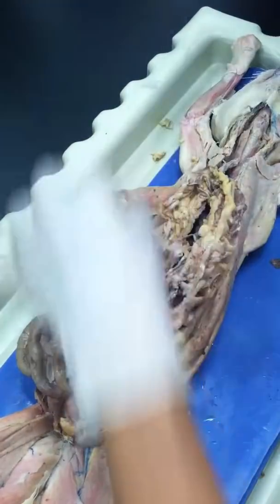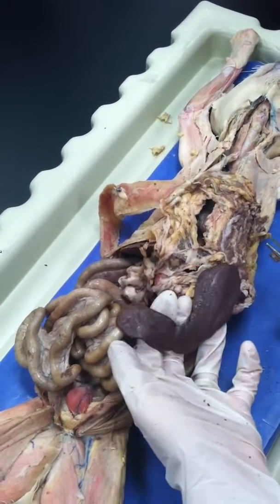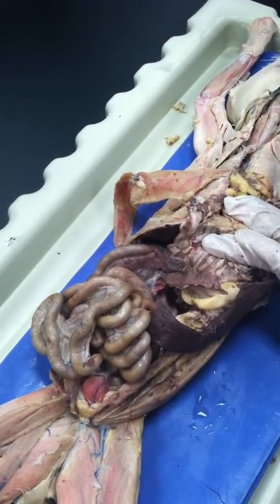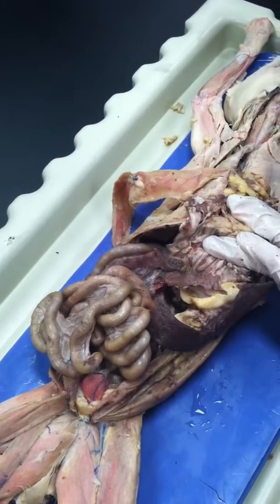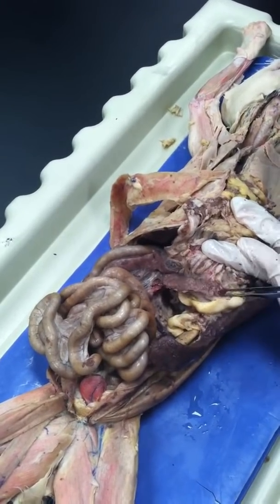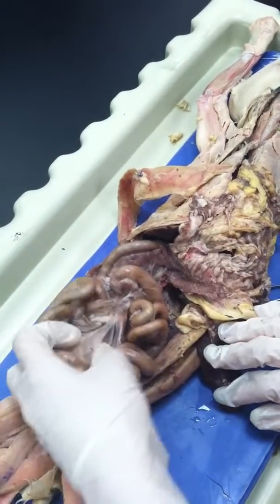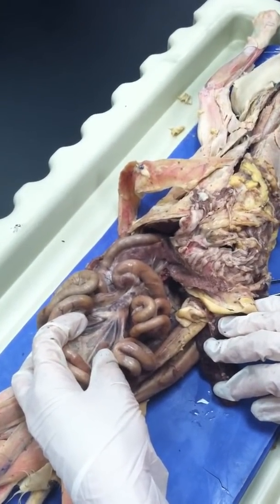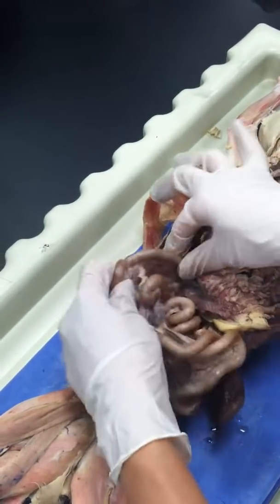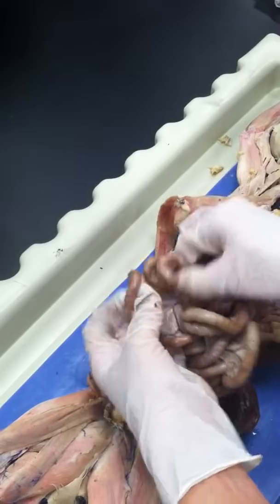Okay, and then this is the spleen. This is a normal size spleen for the cat. And then you go for the pancreas. It's clear in this cat, below the stomach, lower down a little bit. And then you go to the intestine. If you start from just right next to the stomach, you have the duodenum, C shape. And then jejunum, starts to curve.